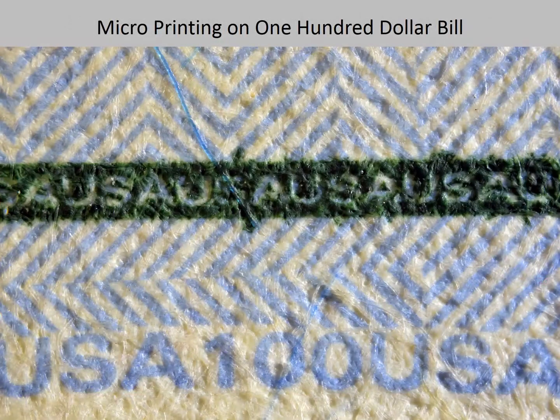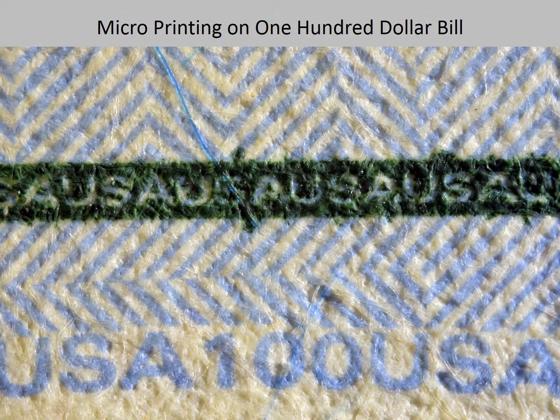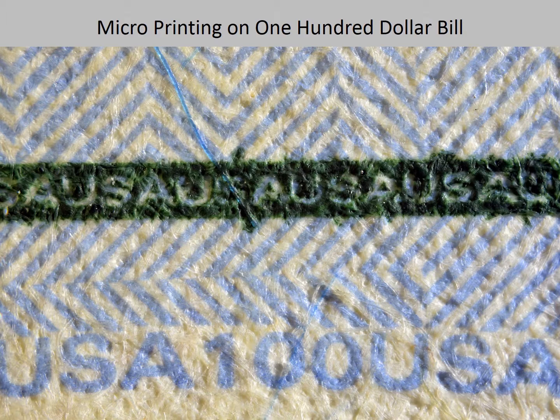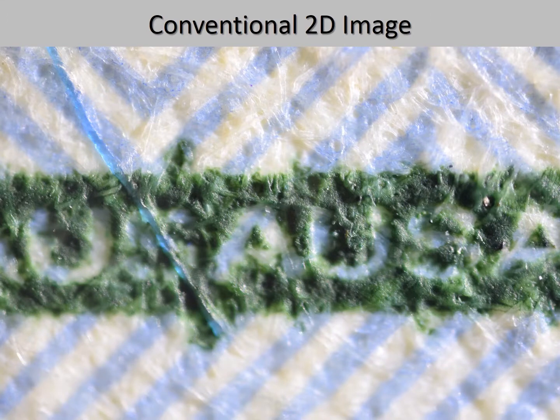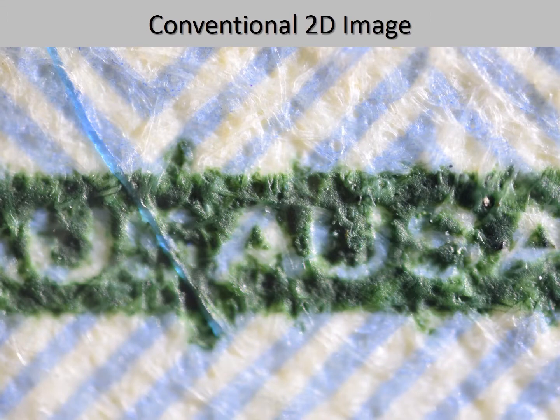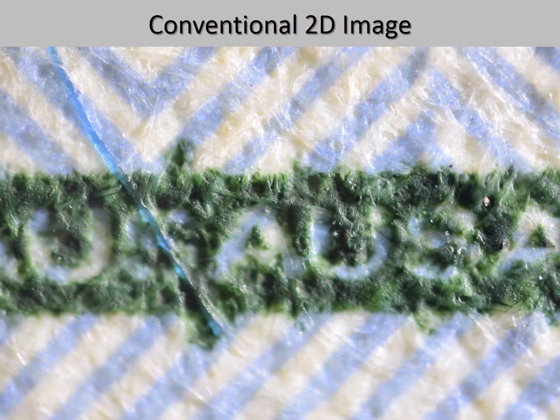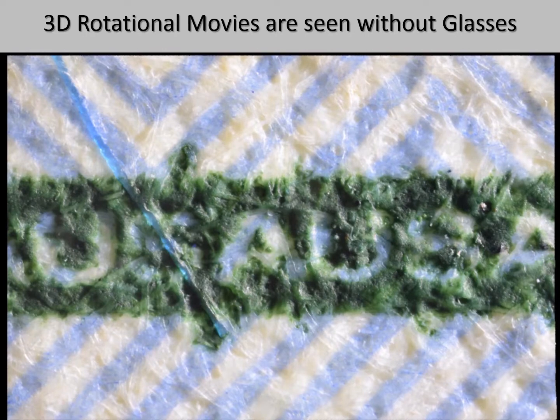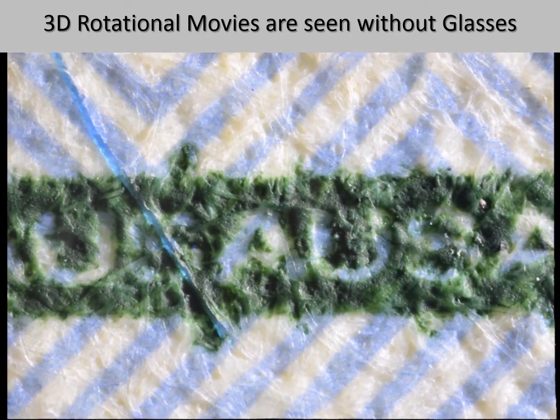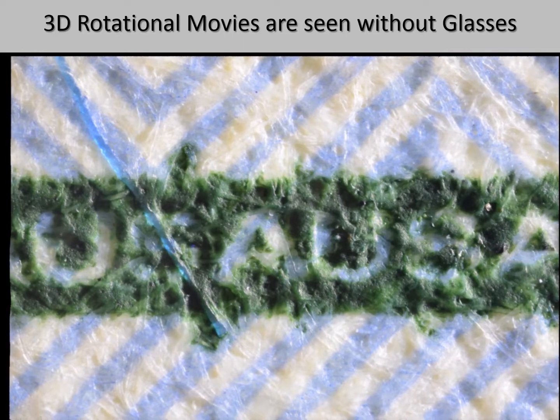This is a picture of the micro-printing on the end of a $100 bill that reads 'USA.' We can see a blue security fiber on the top portion of the image. Here is a closer two-dimensional view of the micro-printing, where only a portion of the image is in focus. This 3D video loop of the micro-printing shows the three-dimensional nature of the micro-printing, along with a closer view of the 3D printing.